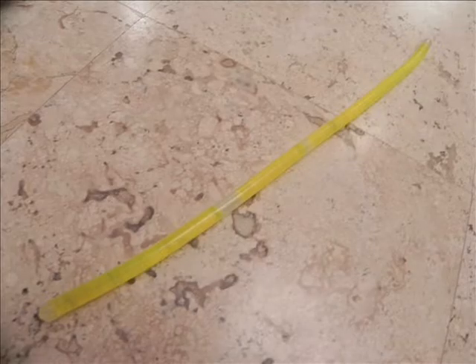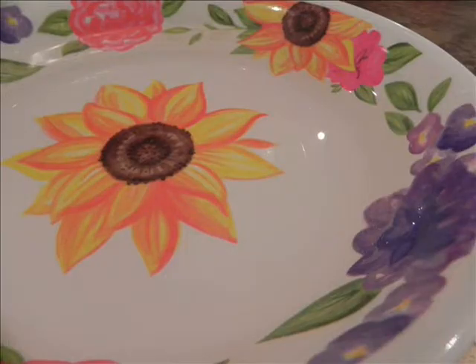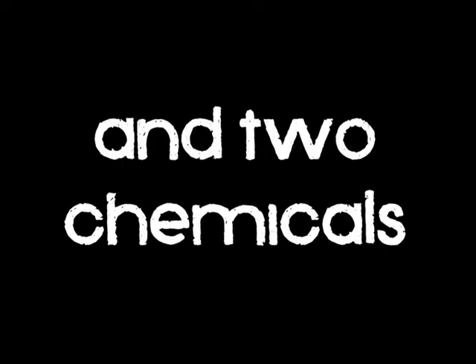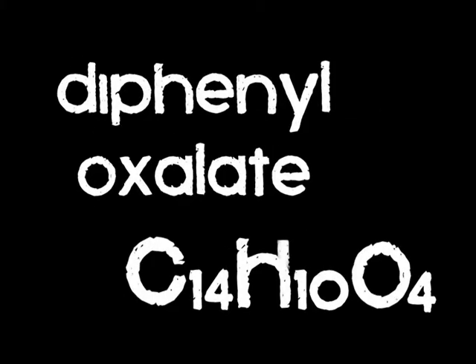The materials we're going to use are glow sticks, scissors, hot water, cold water, a measuring syringe, and 2 chemicals. These 2 chemicals are hydrogen peroxide and diphenyl oxalate combined with the fluorescent dye that, when it reacts, produces light. When a reaction creates light, it is called chemiluminescence. The reaction takes place when mixing the solution, and there is a release of energy in the form of light.